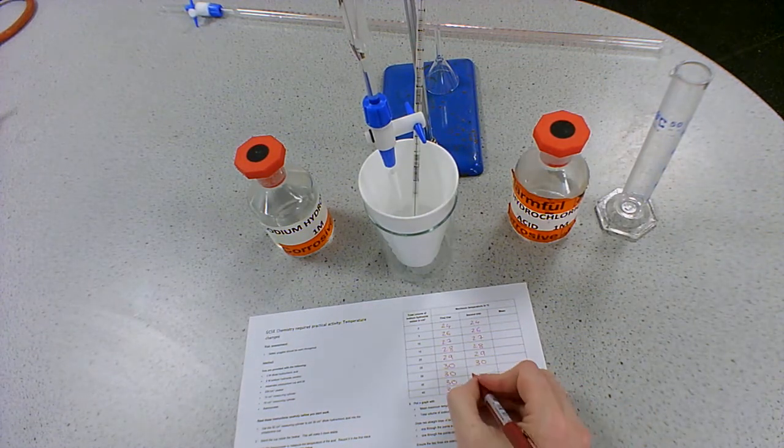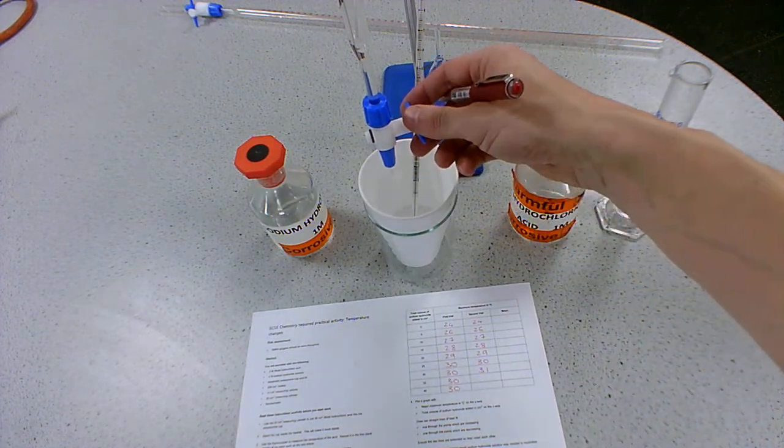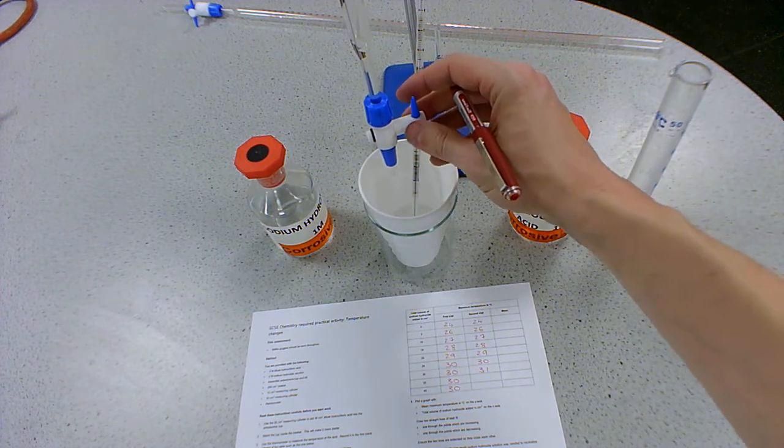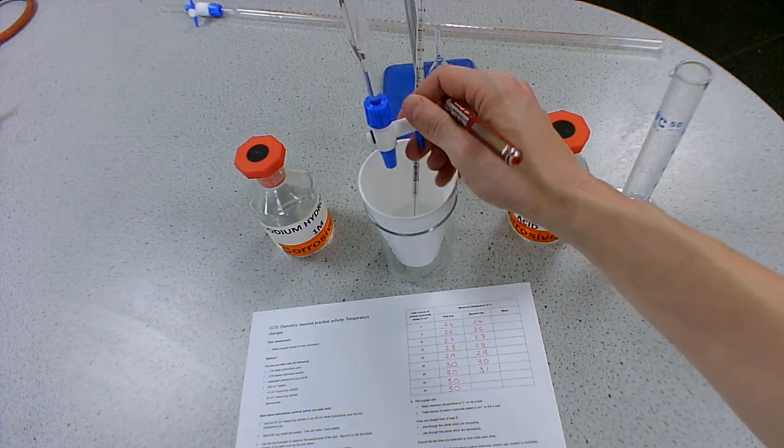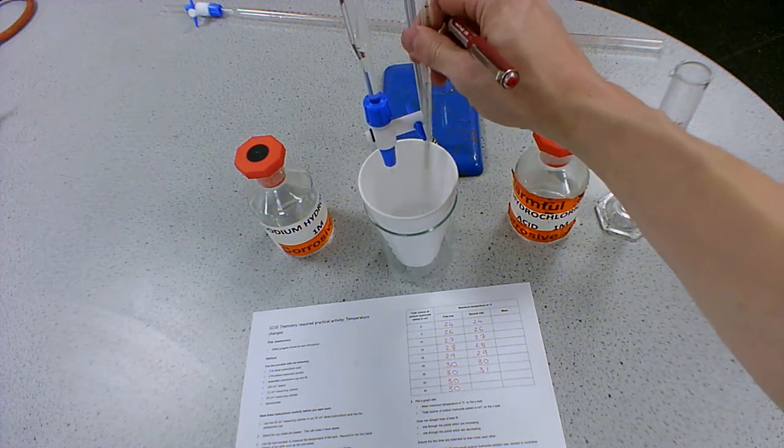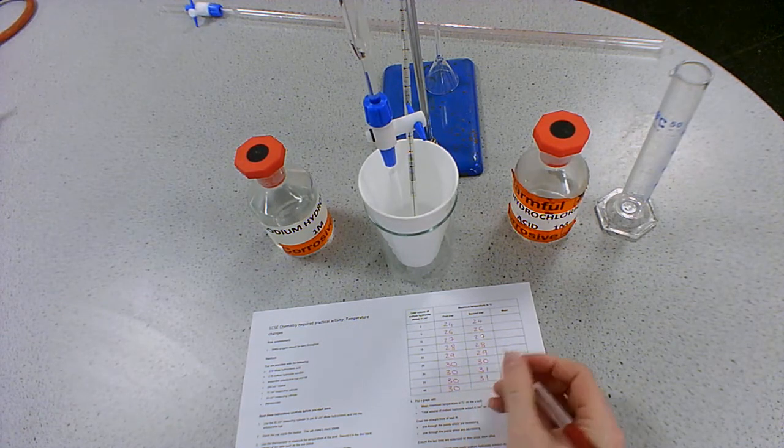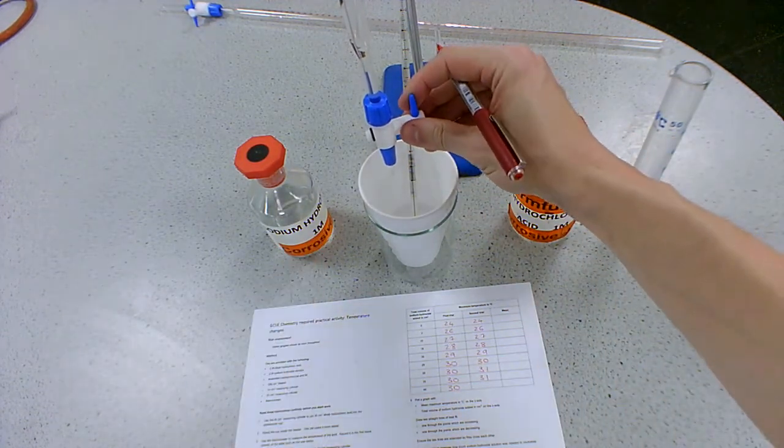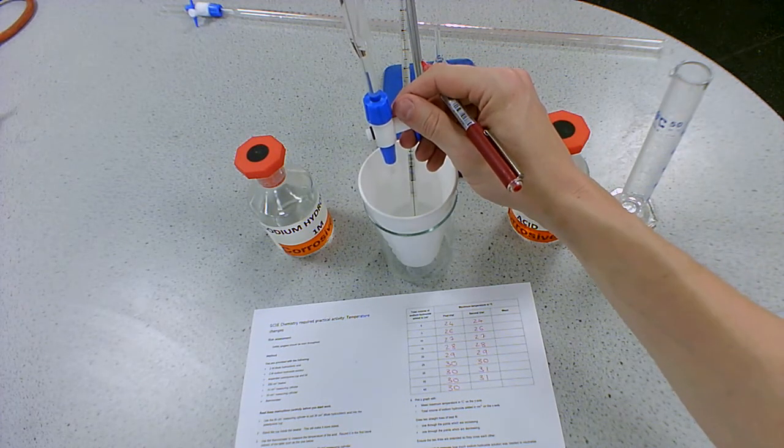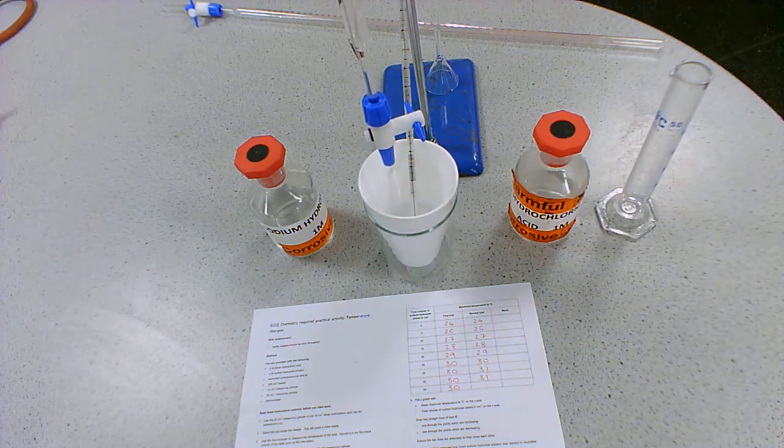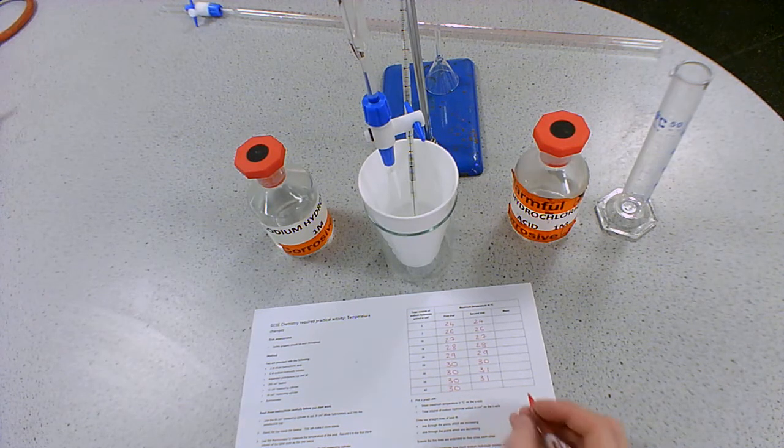Oh, 31 finally, at least one of them has changed, gives you something to calculate at least. And another 5, give it a quick stir, and that one's still 31, and again, last 5 cm cubed, there we go, and it is still 31.